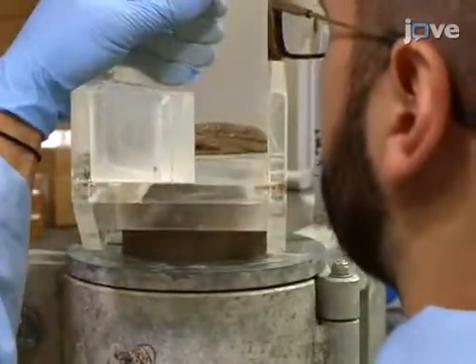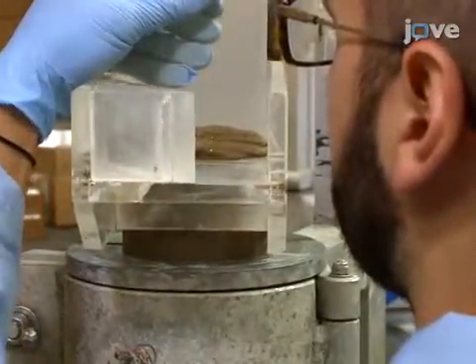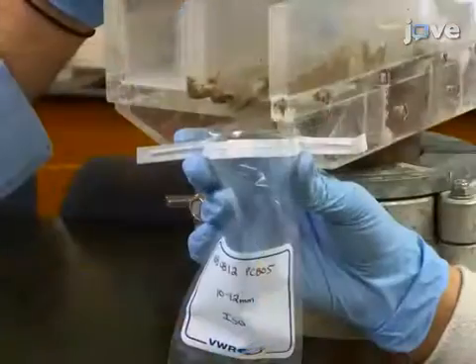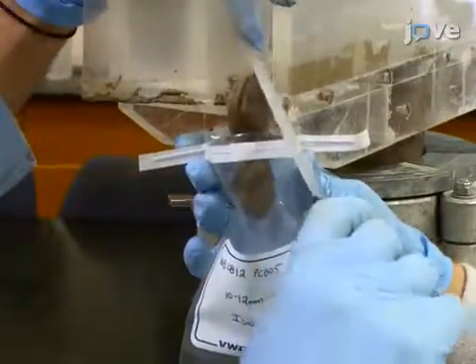Then slowly move the sub-sample towards the edge of the sampling collar and get a collection vessel ready. Then push the sediment into the sampling vessel.